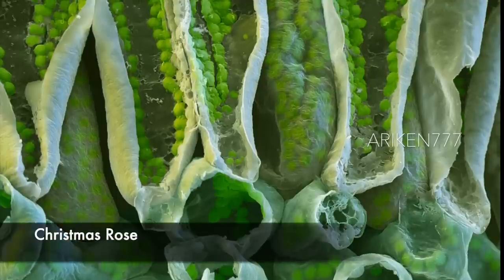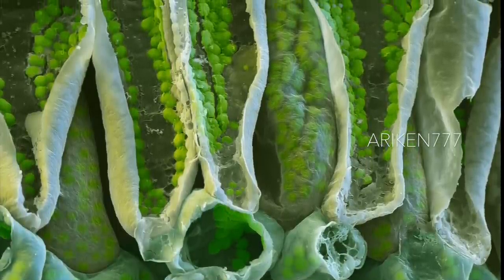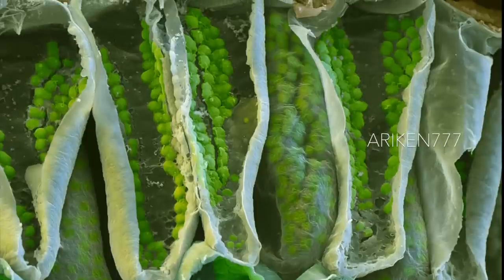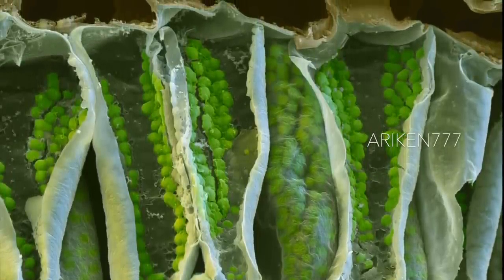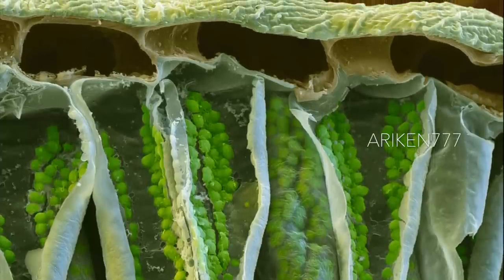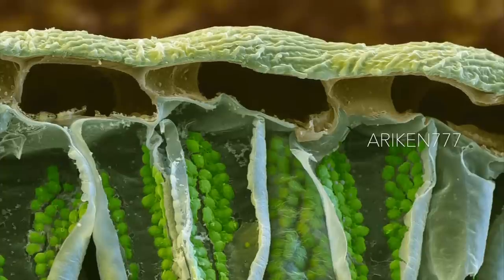The cross section of a leaf of Helleborus niger, commonly known as Christmas rose. This rose is actually a member of the buttercup family, and it flowers between December and March. The flower is saucer-shaped with five white petals. It has golden yellow anthers at the center, which contain the pollen. Around the anthers are the tubular nectaries in green, which produce nectar to attract pollinating insects.